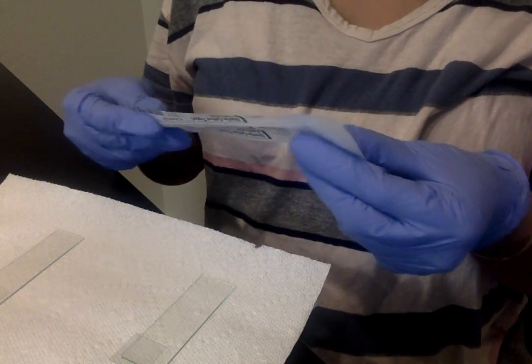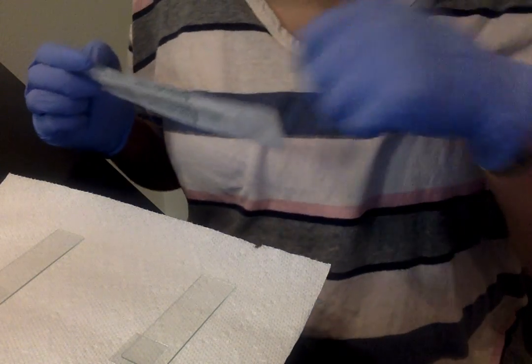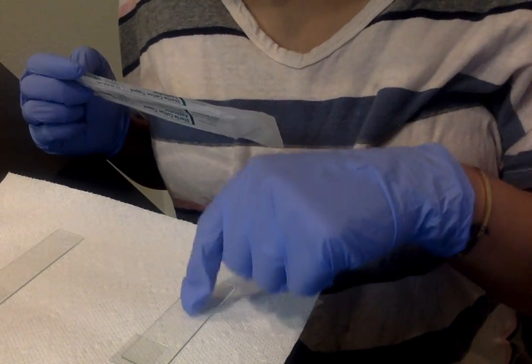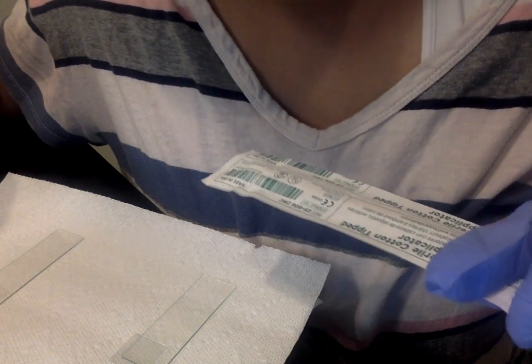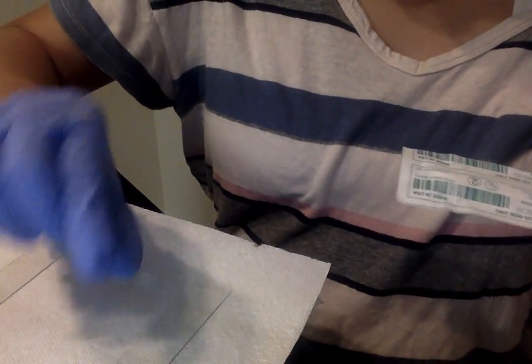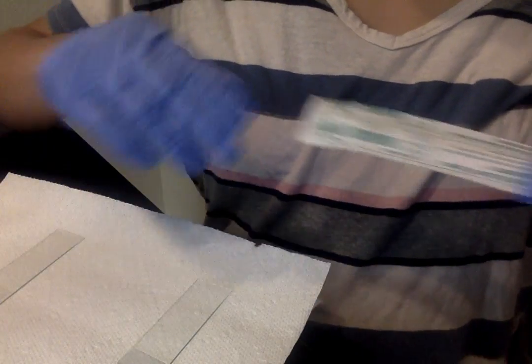Basically, this is what I'm going to do for both. I'm going to take a sterile swab and swab the inside of my cheek, put it on the slide, smear the swab containing the cheek cells, and then add one drop of distilled water on top. Then I'm going to carefully place the coverslip on top of my cheek cells.